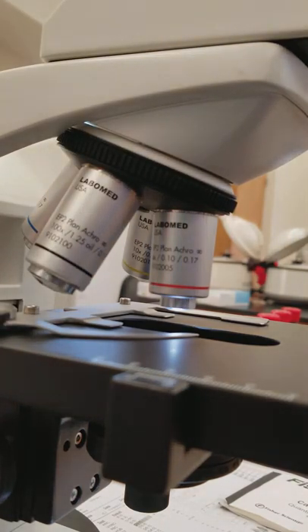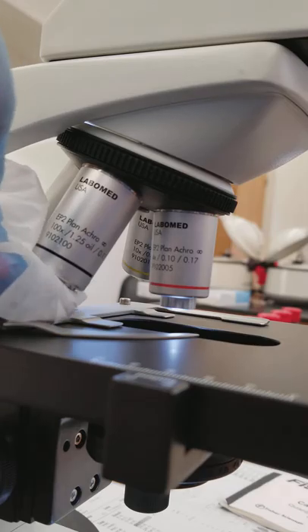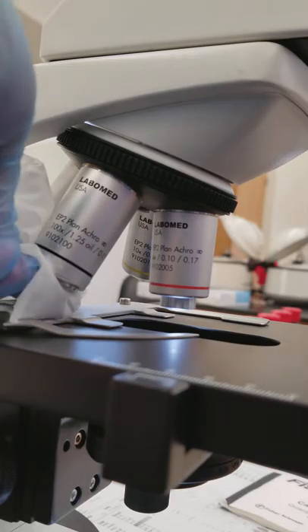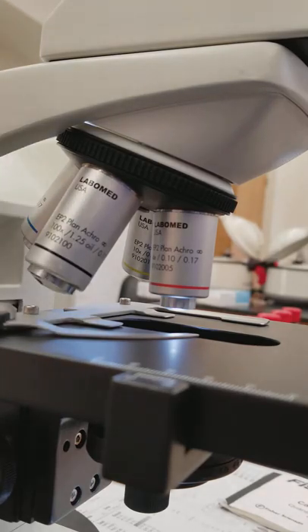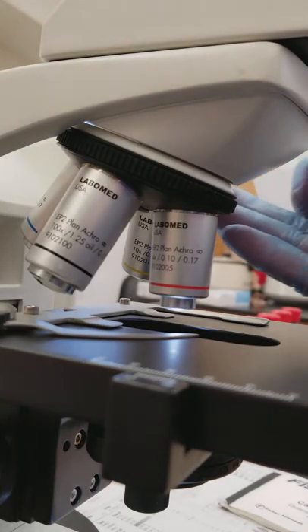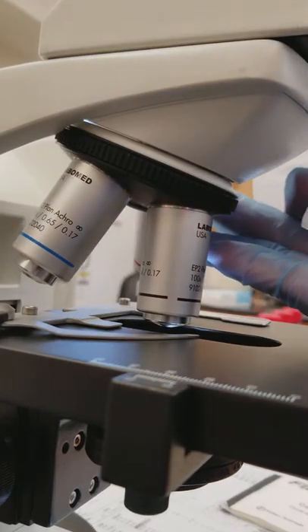I cleaned it off like this, make sure you get good in there. Then using a dry portion of the lens paper, you dry it off. It has to be completely dry - again you'll get what ends up becoming glue and then it cements itself on there.